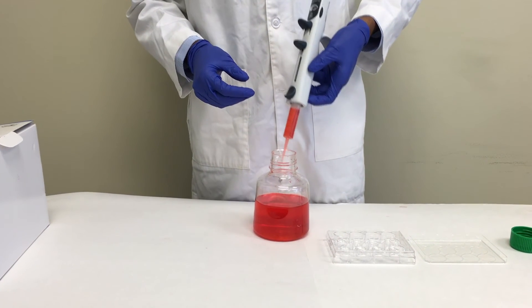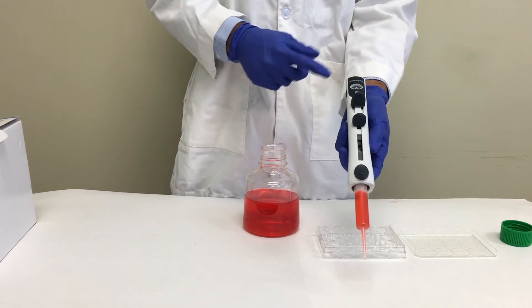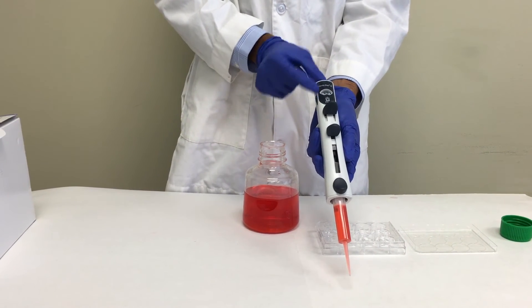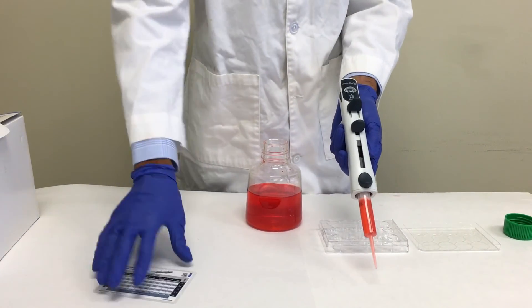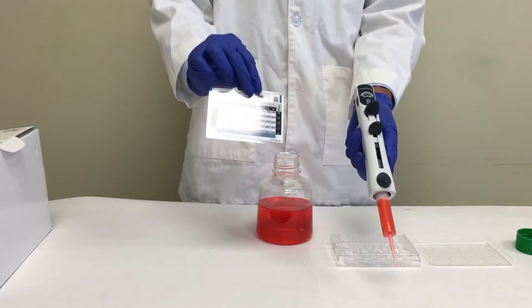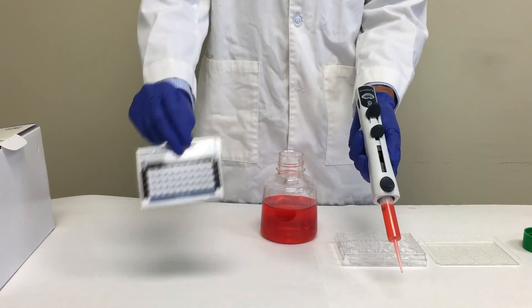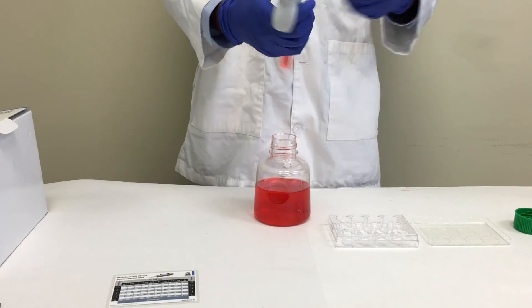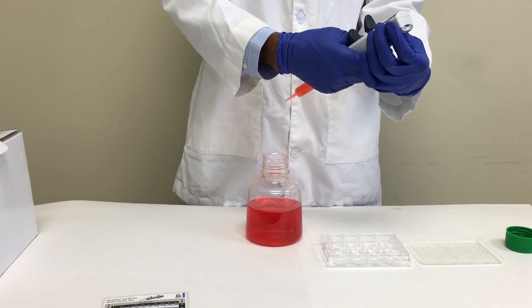Use the stroke setting wheel to choose the setting. The number shown can be anywhere between 1 and 5, increasing by 0.5. The dots on the wheel represent a half step. Make sure you look at your chart when doing this. For example, the dot in between 3 and 4 is the setting 3.5, and by looking at the table, we can see that we can dispense 700 microliters per step for 13 steps.